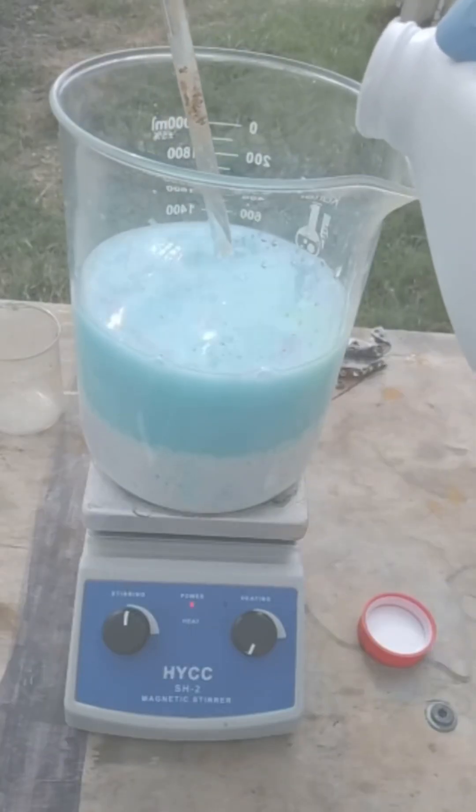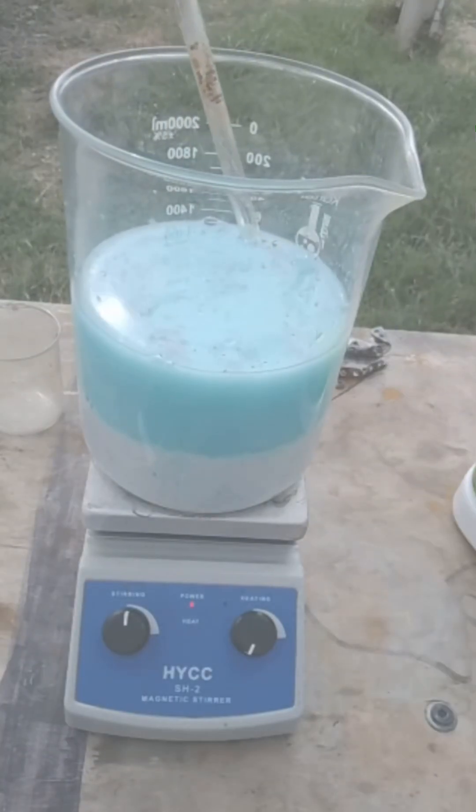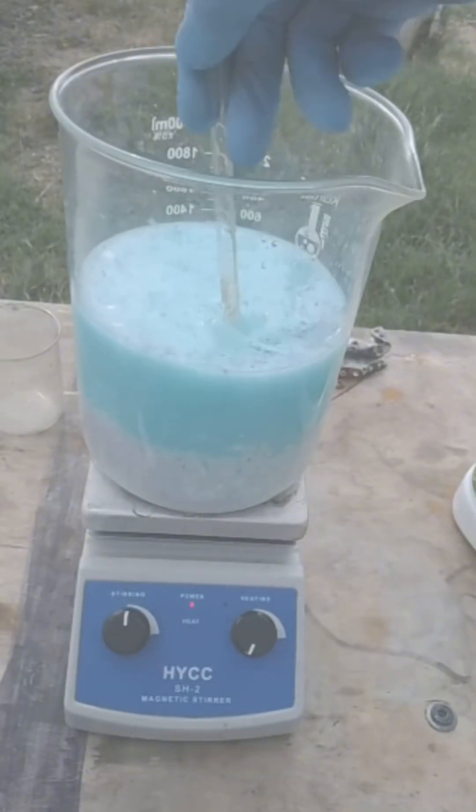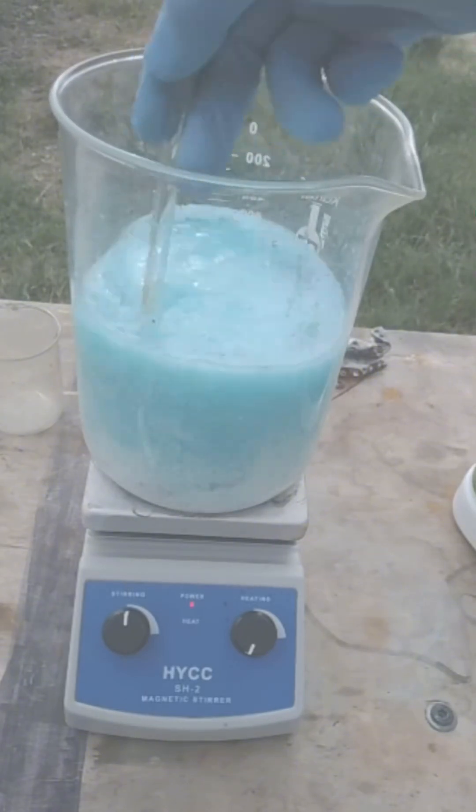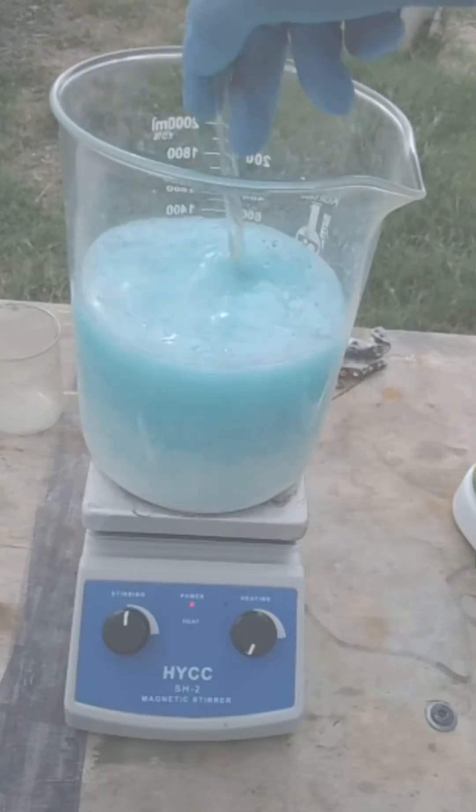So it's very easy guys, don't think oh I can't do this. You can't ruin it. I mean, you can add more muriatic acid, but you can't ruin it because it's just going to drop whatever it can out. So we'll go ahead and move on to the next step, let this play out.